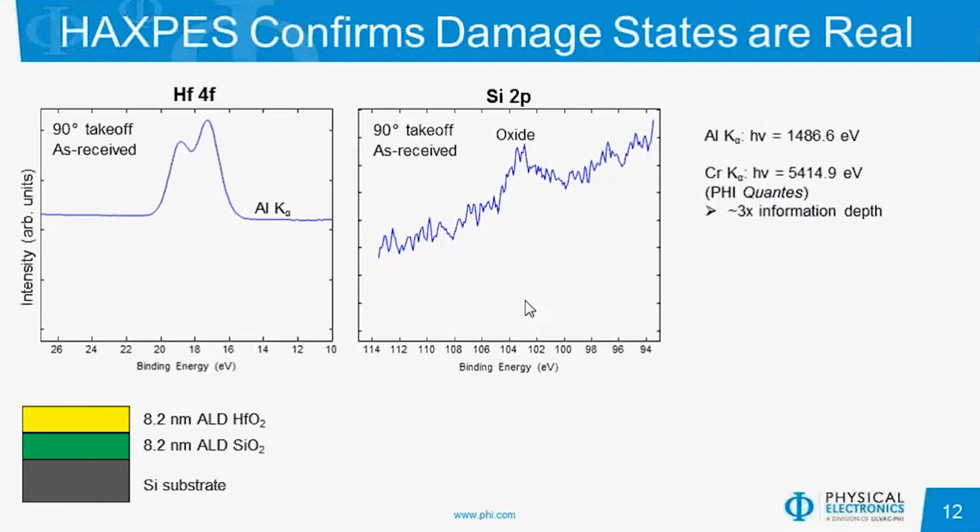What we can use is an alternative X-ray source, such as a chromium K-alpha X-ray beam, which has a higher photon energy that provides us about 3 times the information depth. This analysis was performed on the PHI Quantes system, which allows both aluminum and chromium analysis in an easy system. As shown with the chromium K-alpha source, we again looked at this sample at 90-degree takeoff in the as-received state, so neither of these have been sputtered. And in the Si 2p spectrum in particular, we see 2 states, one that would correspond to the substrate and one that would correspond to an oxide layer.